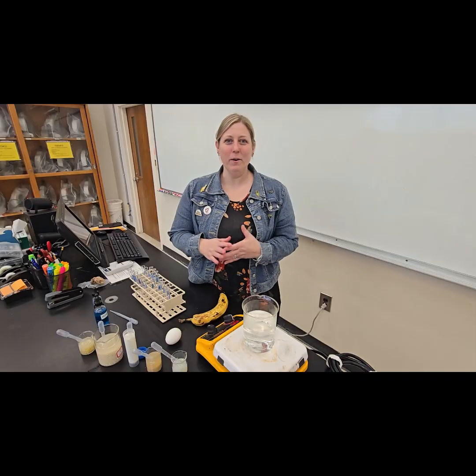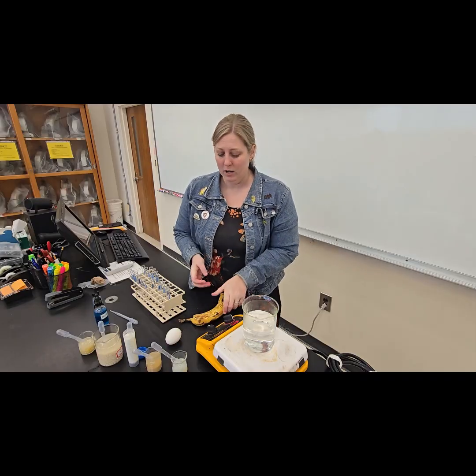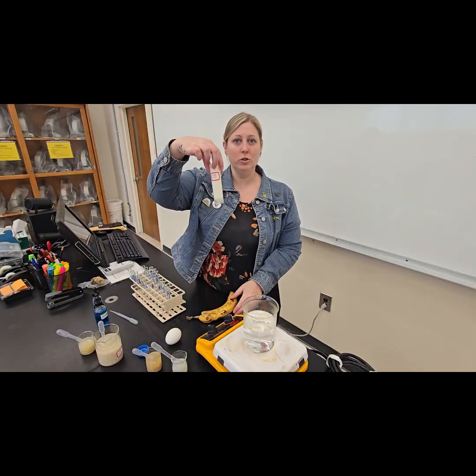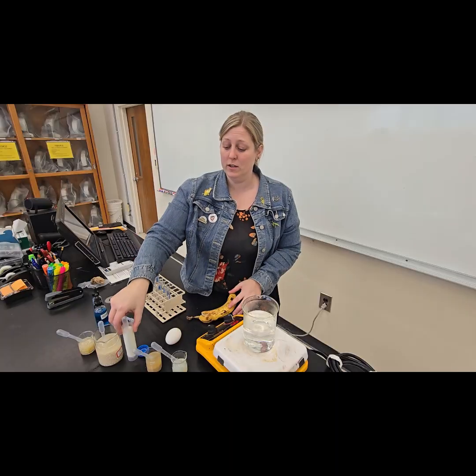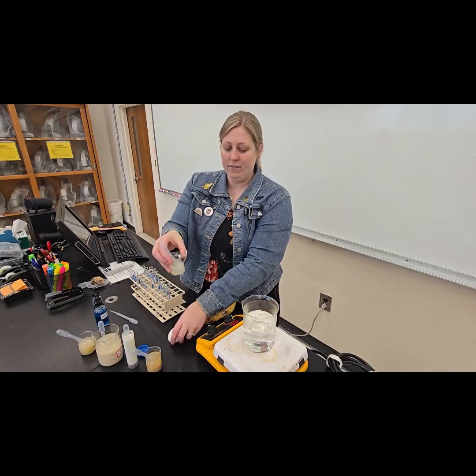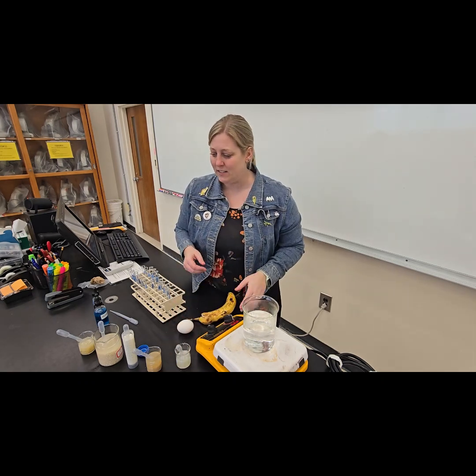All right, so now we are going to test some food items that you probably have in your kitchen at home. So we are going to use whole milk. So you should write a hypothesis for what you think is going to be in whole milk. We are going to use egg white. So we have an egg, just to show you an egg, and we have egg white. We're going to see what's in that.